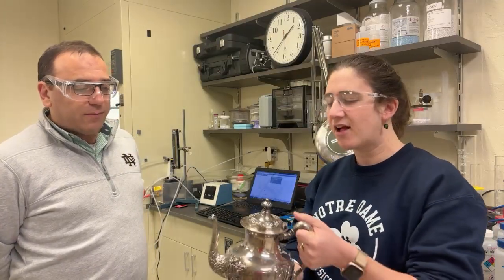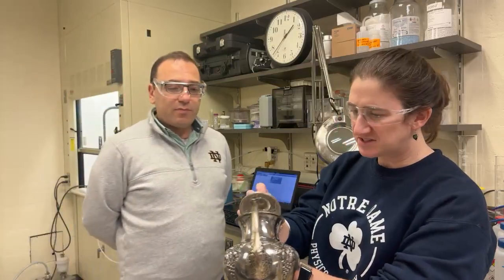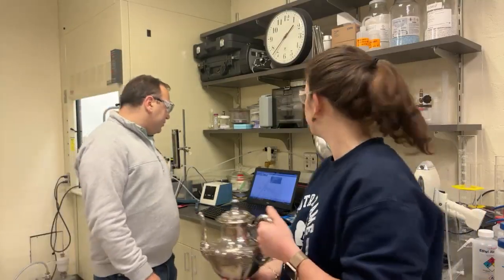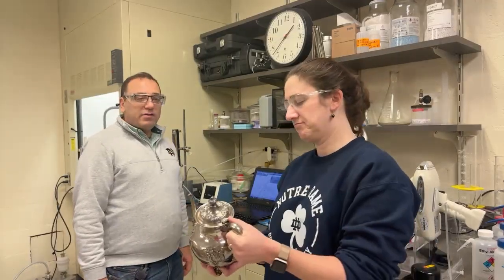So based on excluding any light elements, it should not contain any light elements. That would be pretty striking, although it might be that the silver is oxidized a little bit. Yeah, X-rays penetrate much deeper than the surface. So here you might have some chlorine, some oxygen.